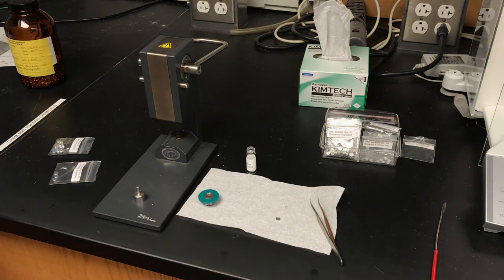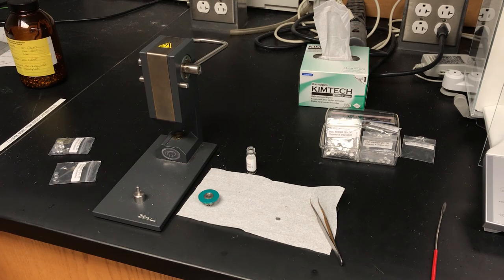All right, so now our sample is ready to go. We'll put it in the instrument and calibrate with the indium.